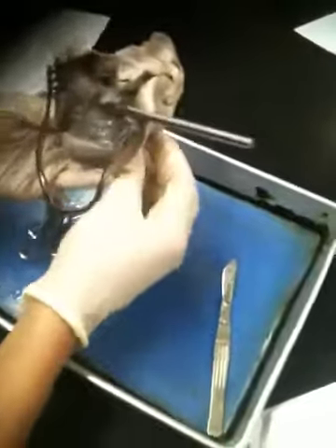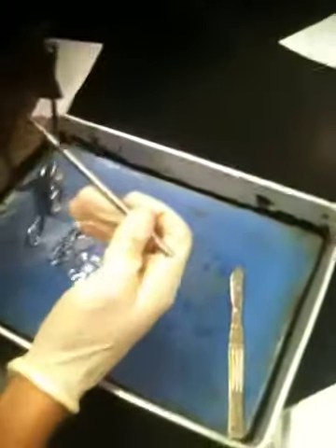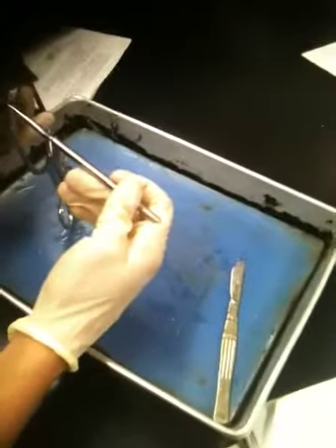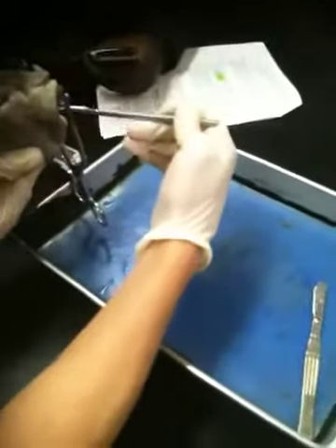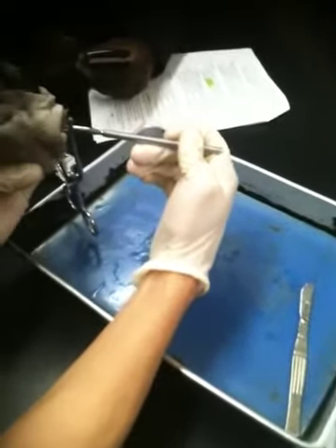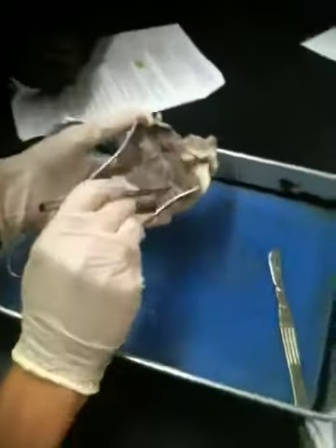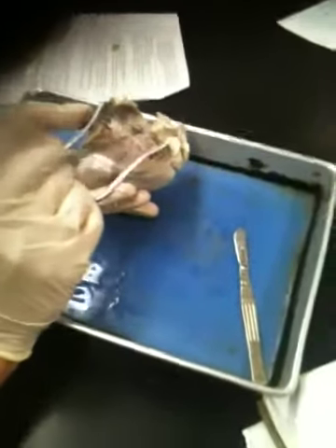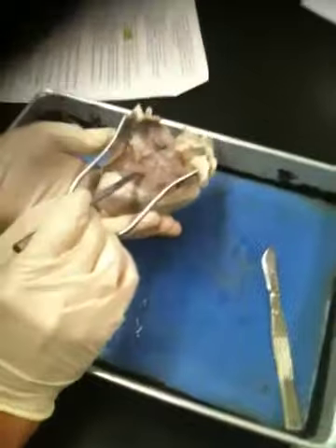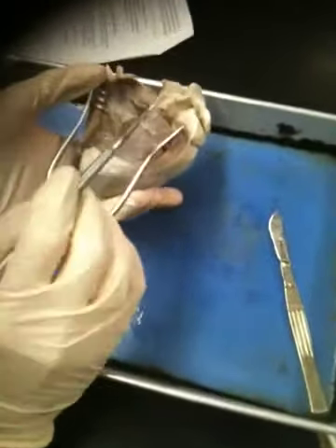Well, let's look at it this way. If I remove that probe and I point down here and I say name the chamber, and notice how clearly beneath the valve you are. What chamber are you in down here? Specifically, which ventricle? The right ventricle, because we know based on the thickness of the wall and the presence of the moderator band that this is the right side of the heart. Therefore, this chamber down here must be the right ventricle. If we said ventricle, we could say right or left. Can you see the papillary muscles on this, or do you just assume? We will in a second.